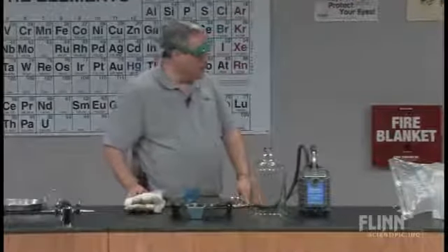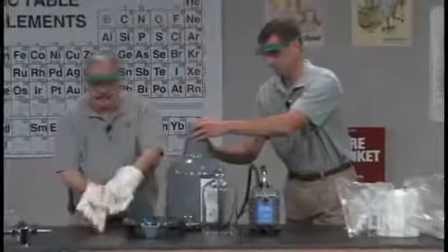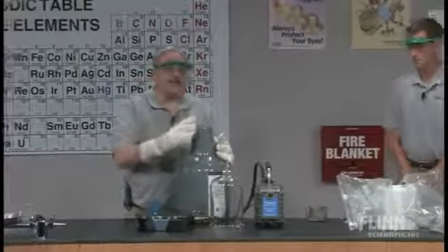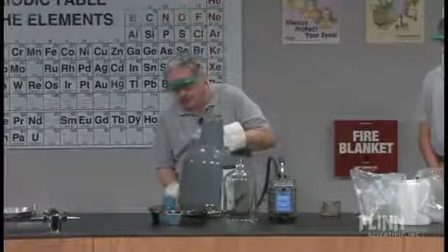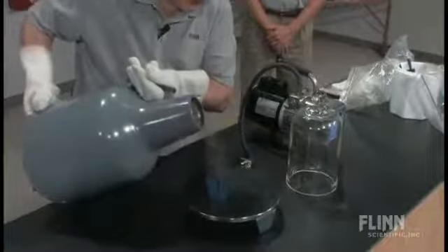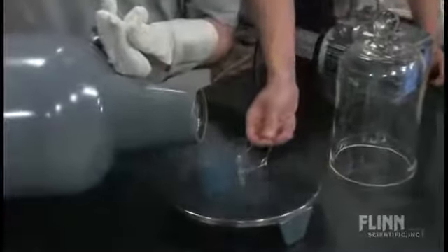So what we're going to do is get some liquid nitrogen. Now, liquid nitrogen is a substance that is approximately 190 some degrees below 0 Celsius. We have it inside a Dewar flask, a specially prepared flask that has a thermos lining that will keep it cool for a while. And so what we're going to do is pour some liquid nitrogen into this little plastic cup. Now we're going to pour it in and just keep pouring in, and we want to get the cup cold, colder, colder.